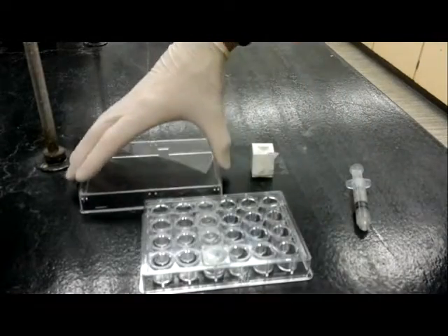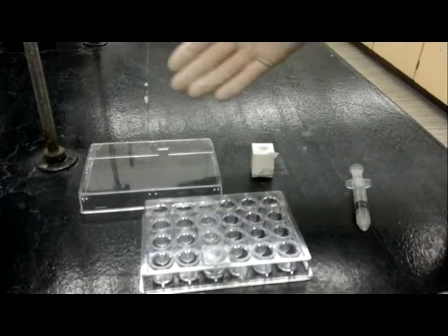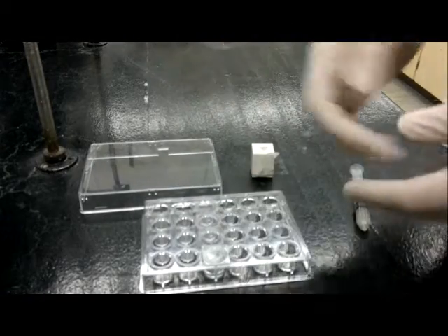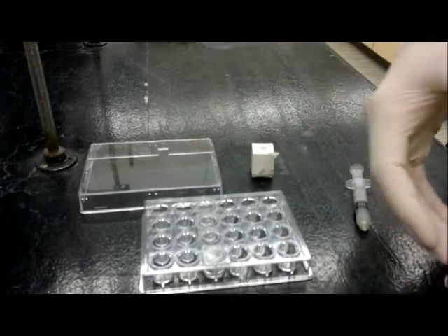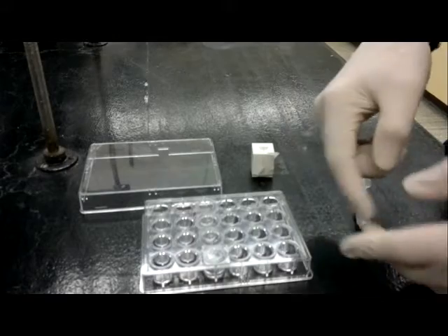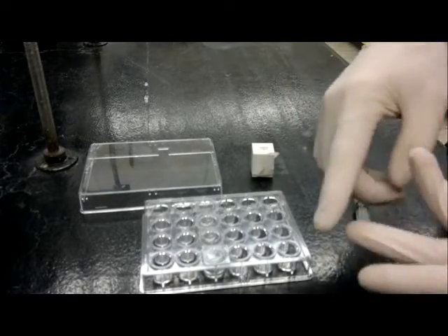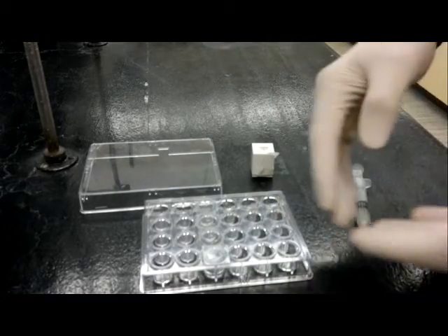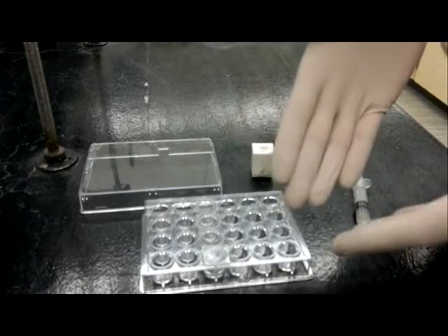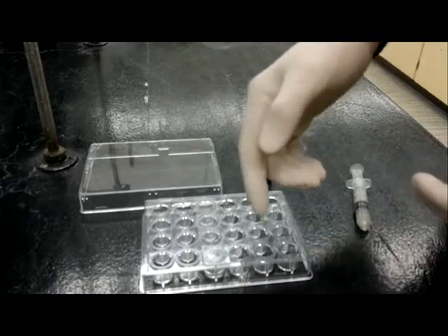Now the first thing you're going to be doing is assembling, once you've finished determining the concentration of your lysozyme and adding the correct buffers, your precipitant solutions. So each well that you're going to be using will have a precipitant, be it sodium iodide, sodium chloride or sodium bromide, and you'll be using a buffer solution of pHs either from 4 to 5.5. You'll be mixing that in the wells.